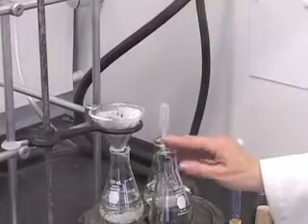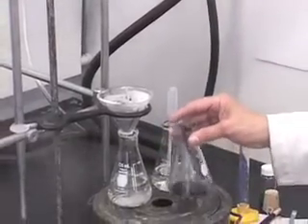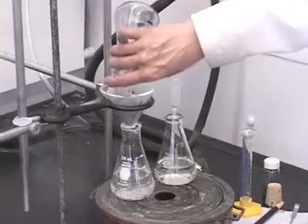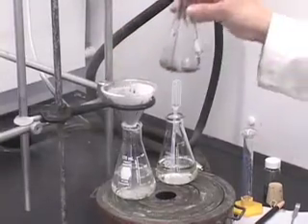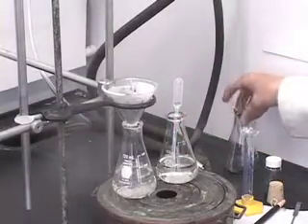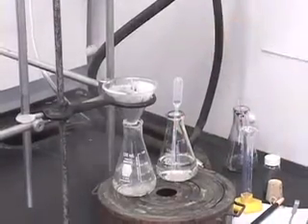As I said, again, it is not necessary that it be exactly 5 milliliters. So pour this as well. Now we have made sure that we have transferred all of the compound. So this flask is done. We will wait for all of that to filter.